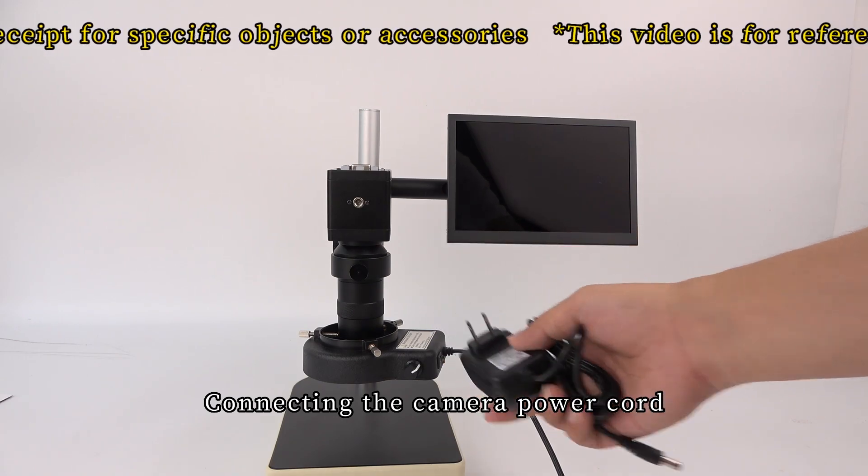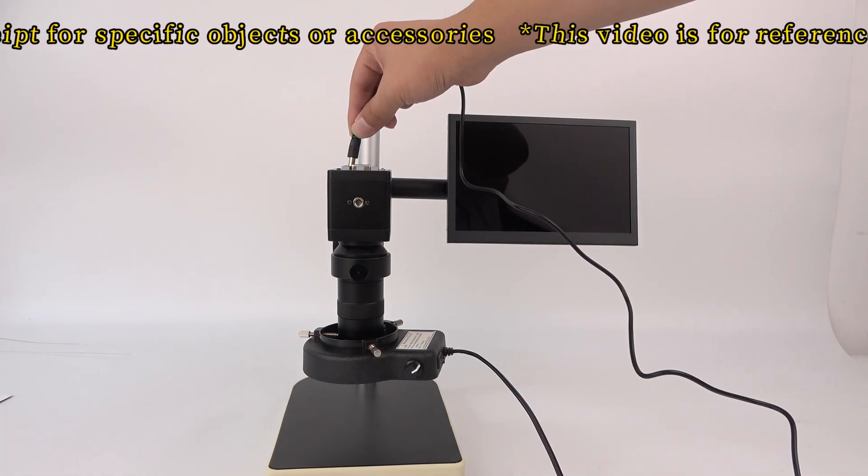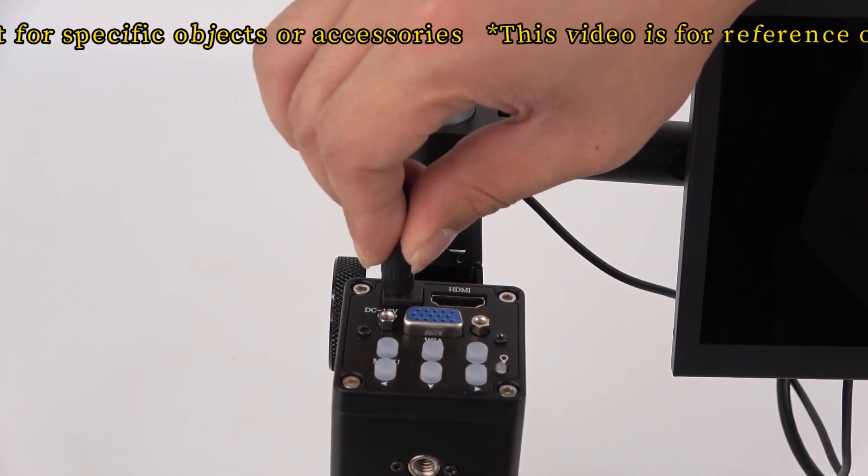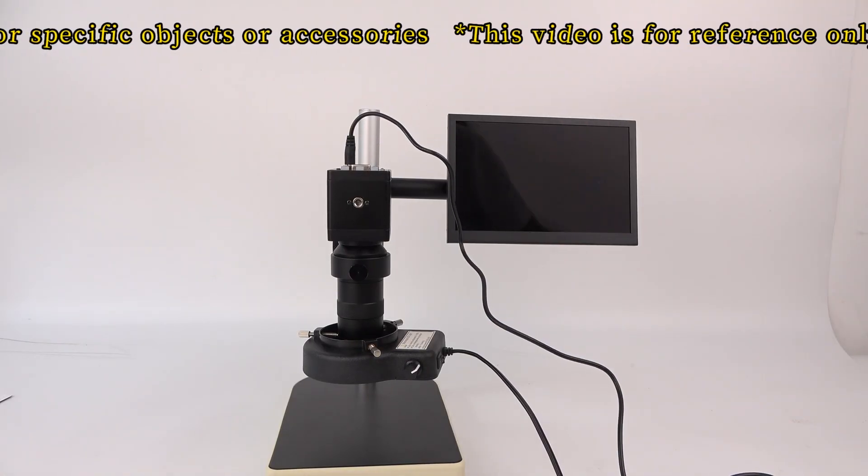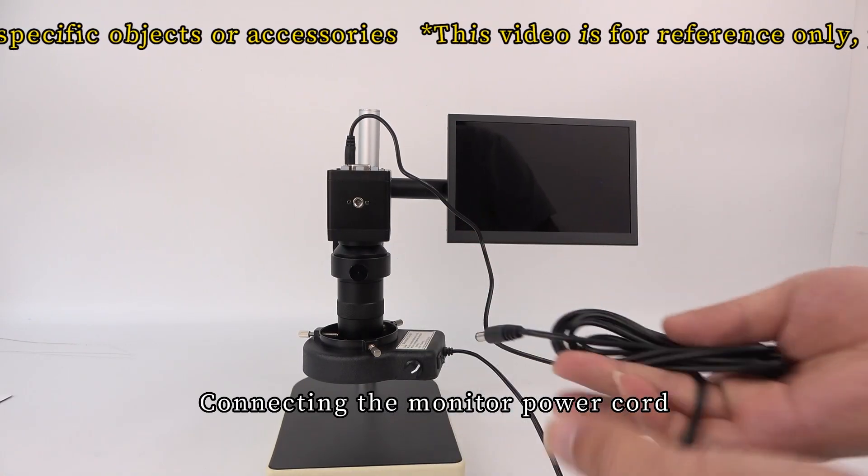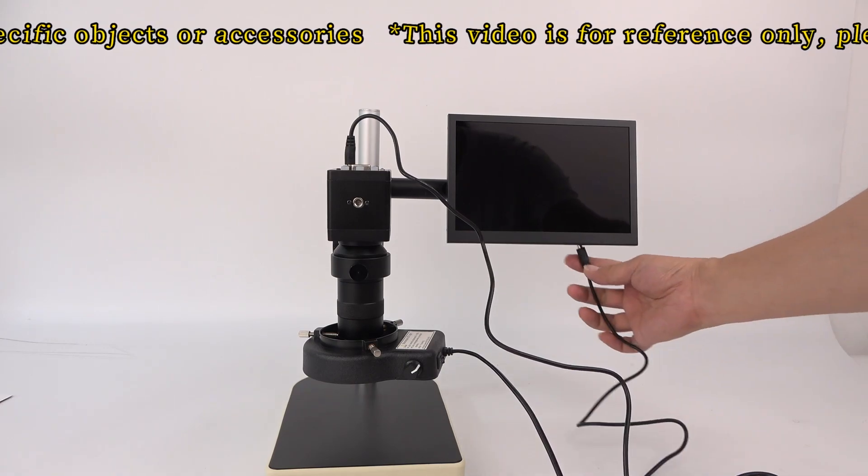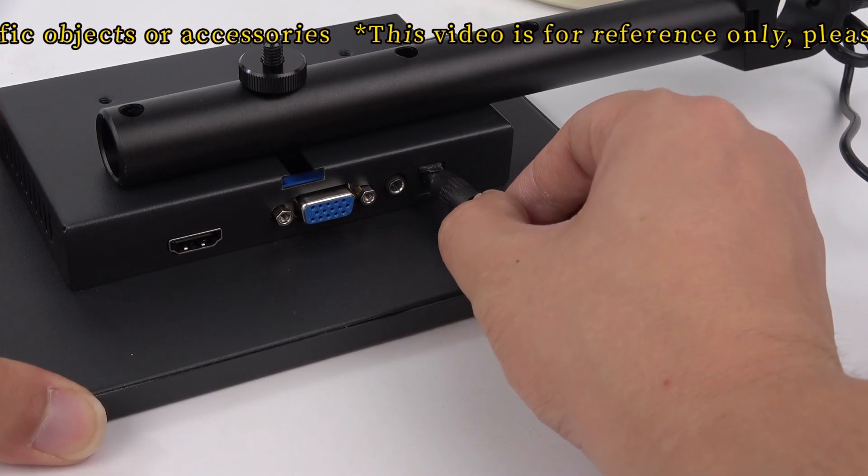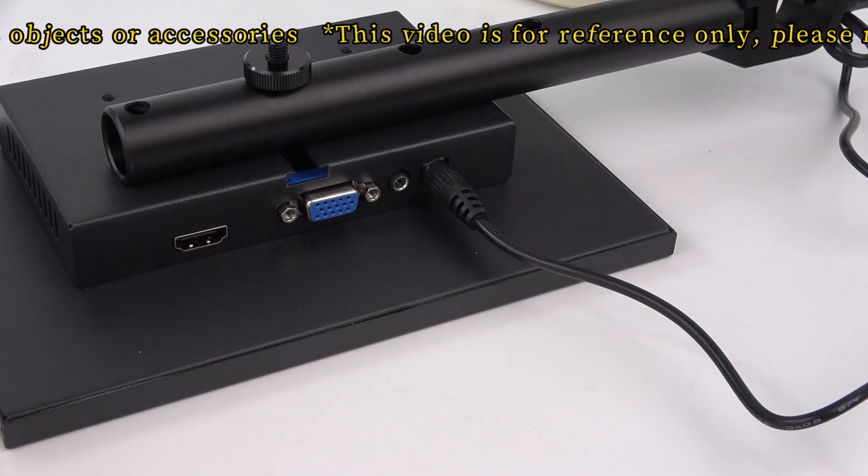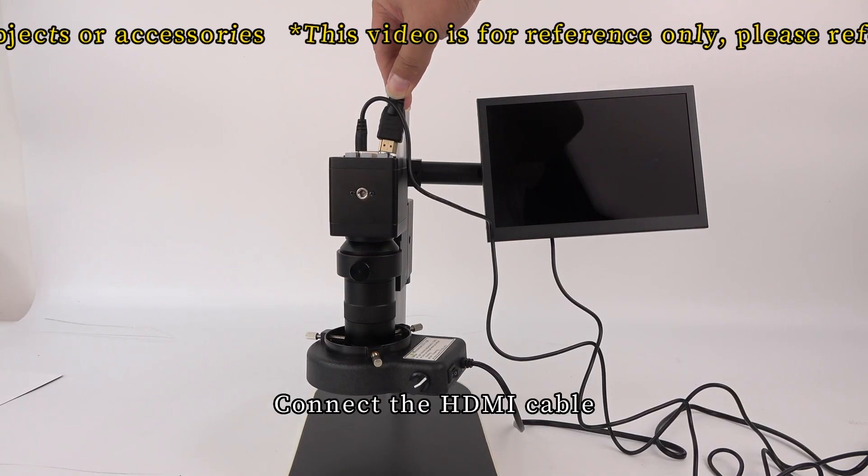Connect the camera power cord, the monitor power cord, and the HDMI cable.